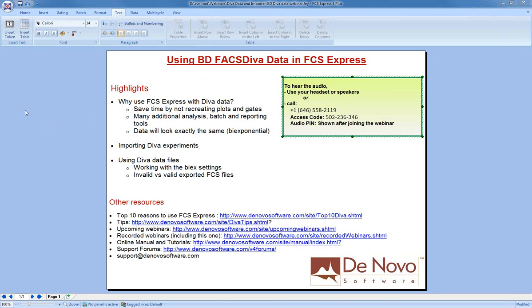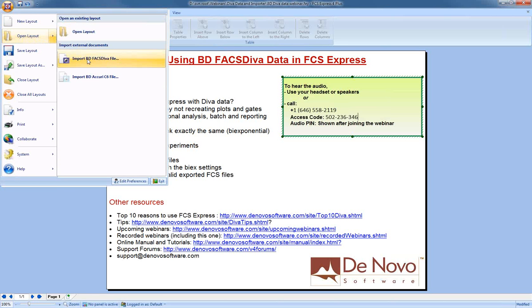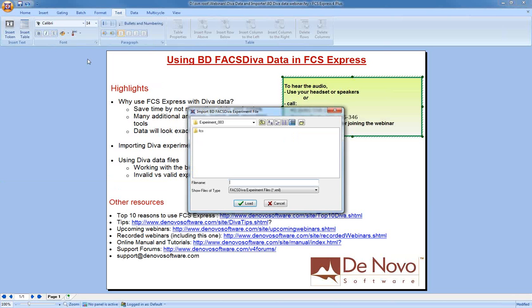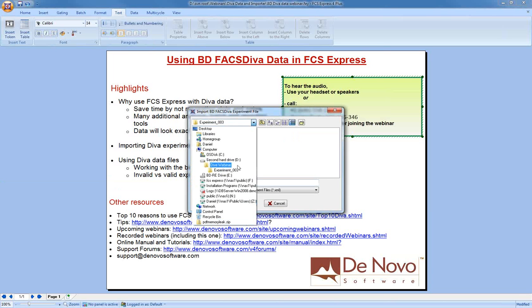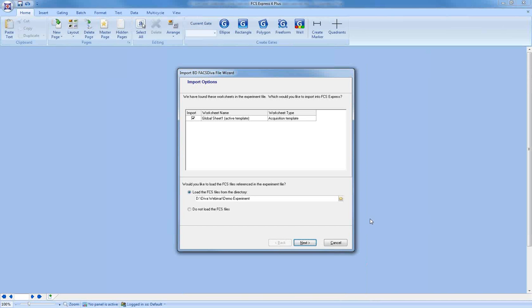So inside FCS Express, what I'm going to do is go under the Application button. I go under Open Layout, Import BD FACSDiva file. And on my hard drive, I find the demo experiment, and the XML file is what it's looking for. And it's going to ask me, what do I want to load? So there's a number of options here. Now there's only one worksheet that's inside this XML file, so there's no choices. And I'm going to say to load the data file, the FCS files from this folder.